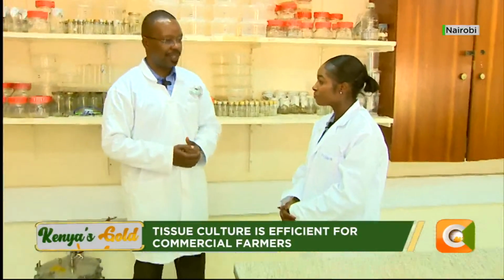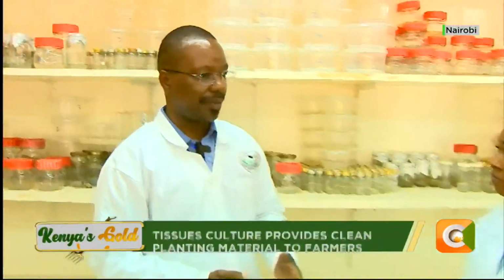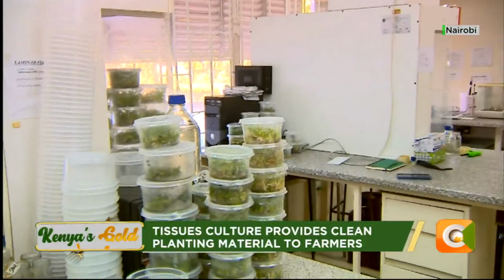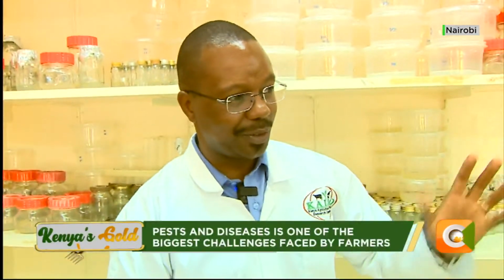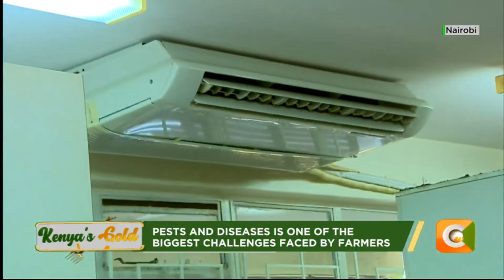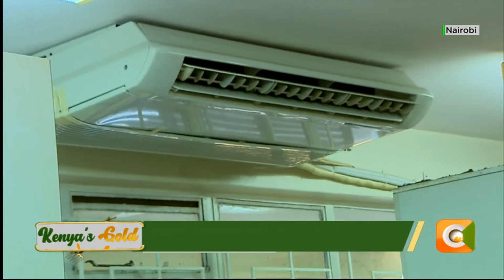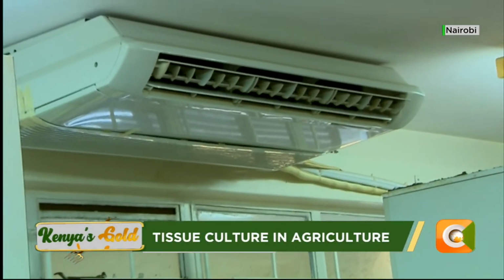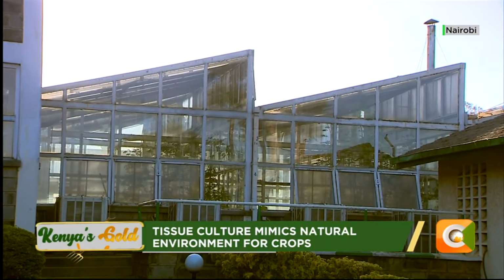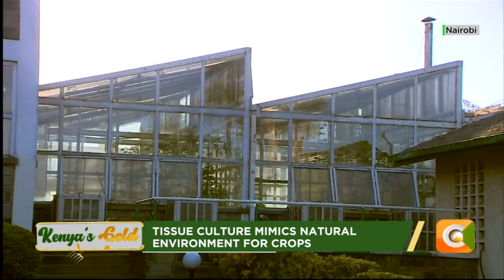First of all, there is maintaining the cleanliness. That means the procedure we use, using the right attire, so whatever is outside, we don't contaminate. Then we have an air con. That means the air that is in is being regulated by an equipment. When you look at this facility, there is no air that is just coming in, because air carries a lot of contaminants. So this environment is quite sterile. The environment is being cleaned.